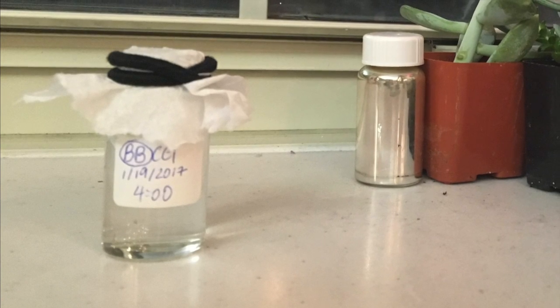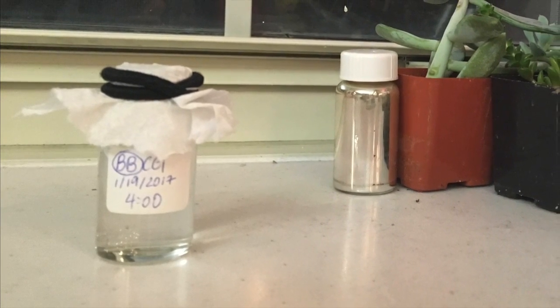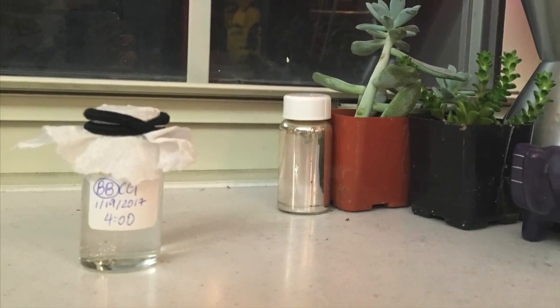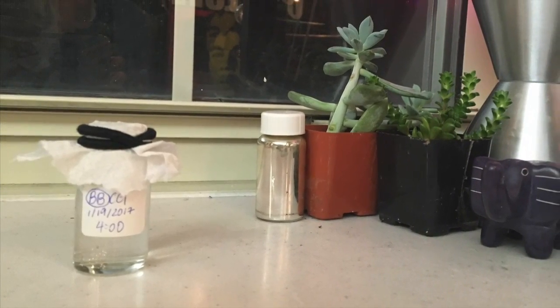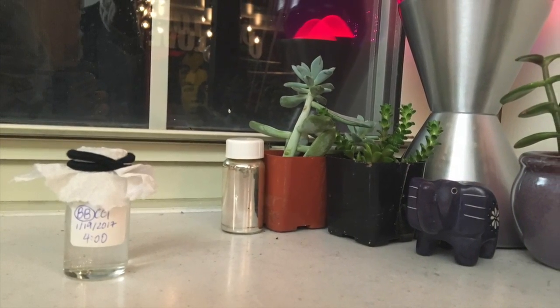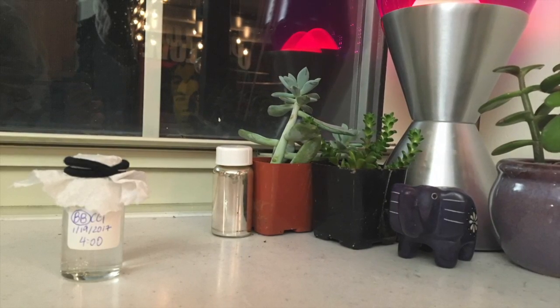Additionally, my vial is on my windowsill, about 5 inches away from a lava lamp. I put my vial far away from the lamp to keep heat from the lamp from being transferred to it. However, small amounts of heat might be entering the system and disrupting the crystal growth. I will rectify this by moving my lamp away and keeping the extra heat from entering the system.